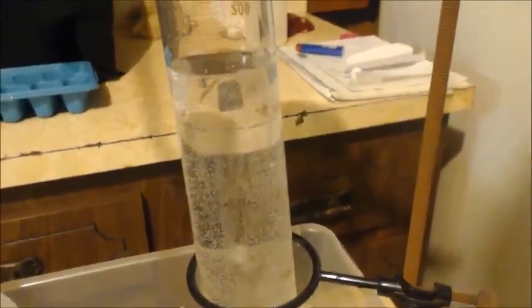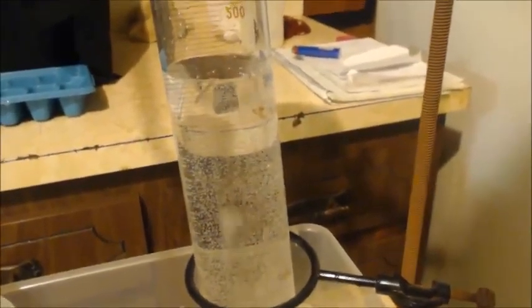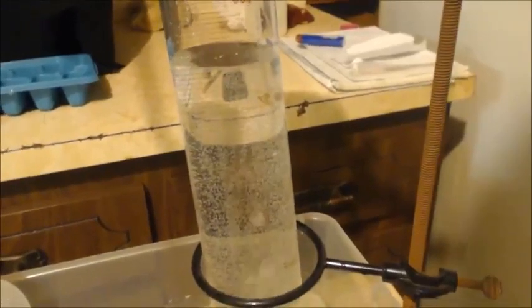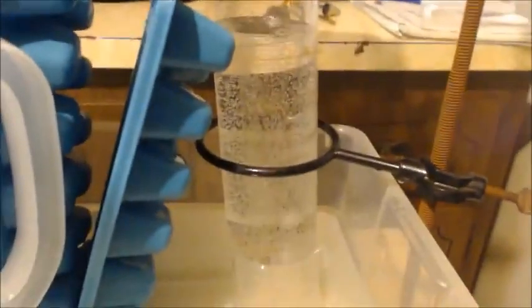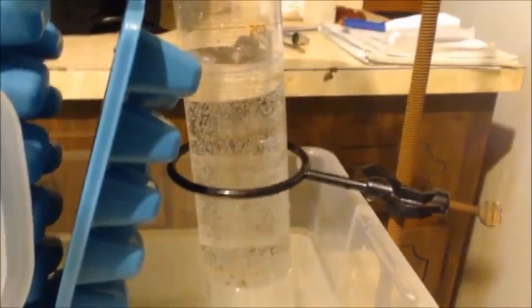This might not be a better reaction, they say the aluminum oxide is the best way to dehydrate an alcohol. But boy, this seems like you really have control. I mean, I'm not even doing anything. I just got the heat set at the right temp, it's coming out perfect. Still going, it almost stopped. If I wasn't watching, I had to turn the heat up. Look at this, how it's like purple. I don't know if you can see that on camera or not, but it is like purple purple. That's unexpected.